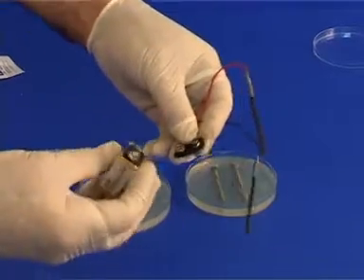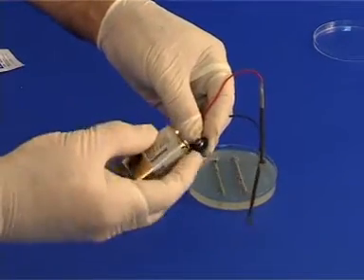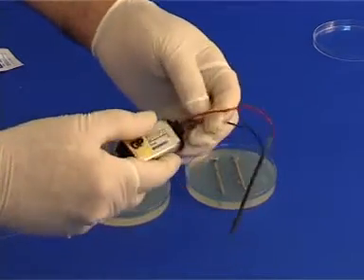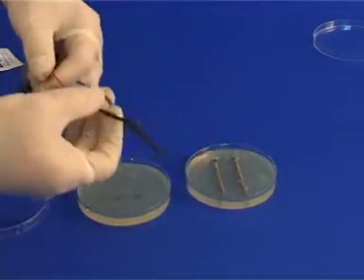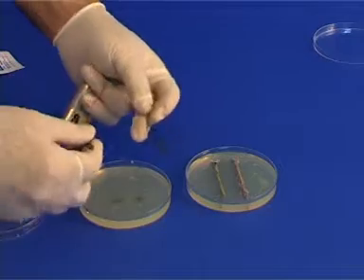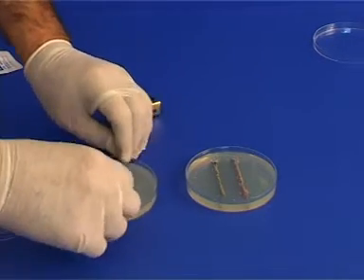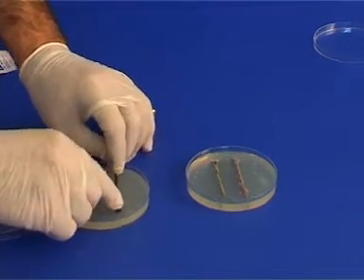Now, take the two nails that are attached to the wires, connect a 9V battery to the battery connector, and introduce the nails so that the nail attached to the red wire is above the plus sign in the petri dish, and the nail attached to the black wire is above the minus sign.